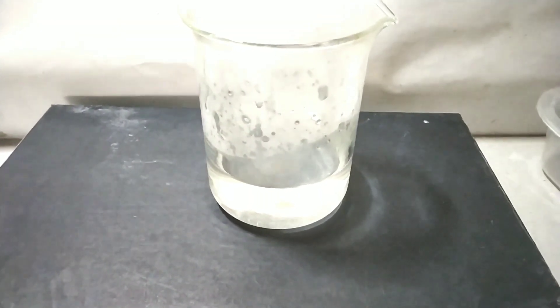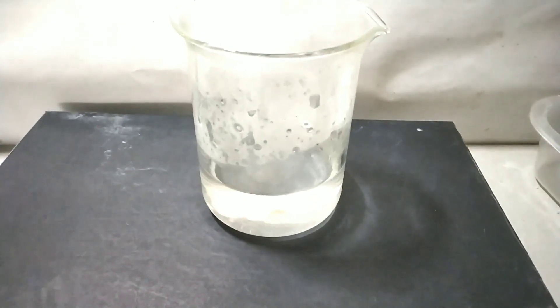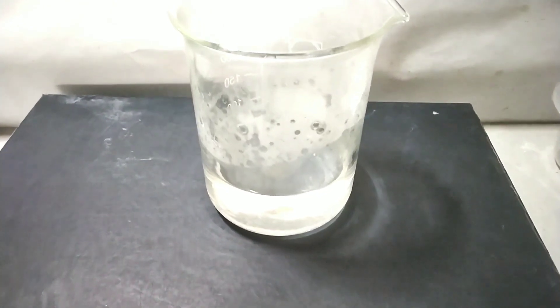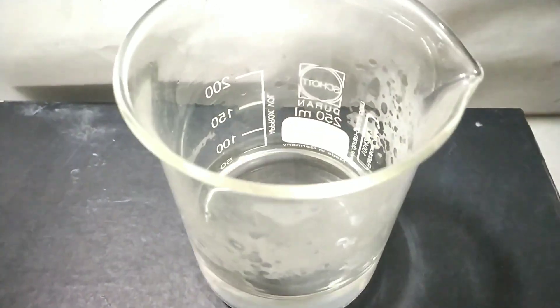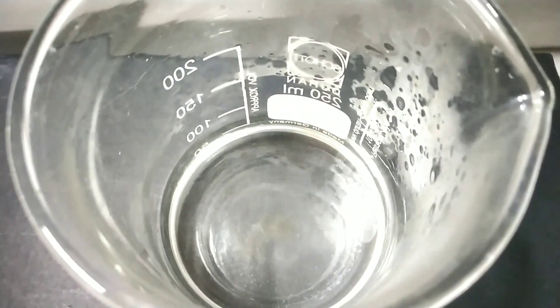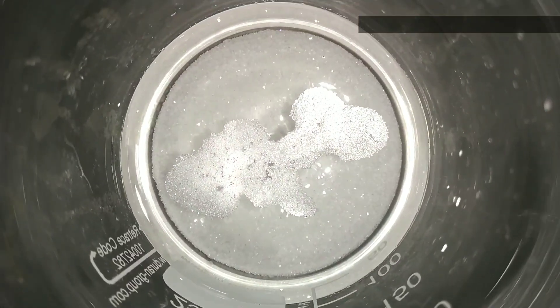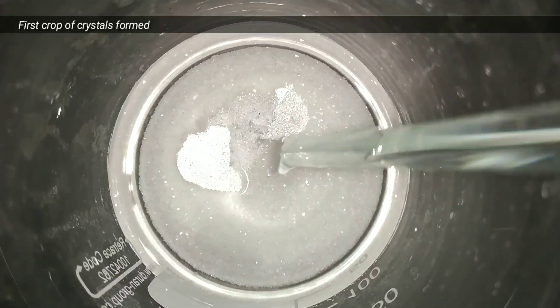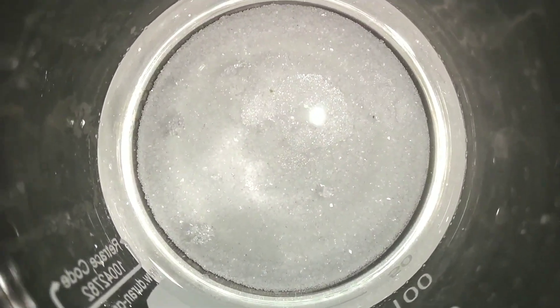Now we take it out from the heating source and set it aside for cooling. On cooling, crystals of lead(II) nitrate start to separate out. You can also see some crust formation and a white crystalline solid at the bottom of the beaker. This is the yield from the first crop of crystals.